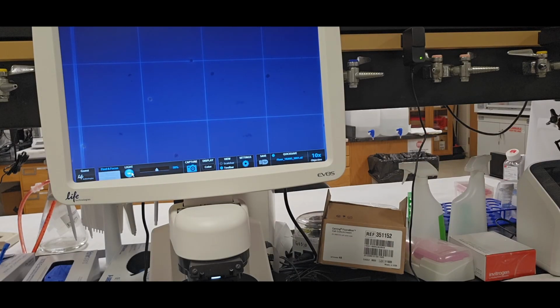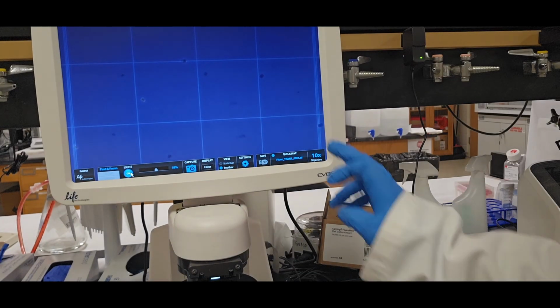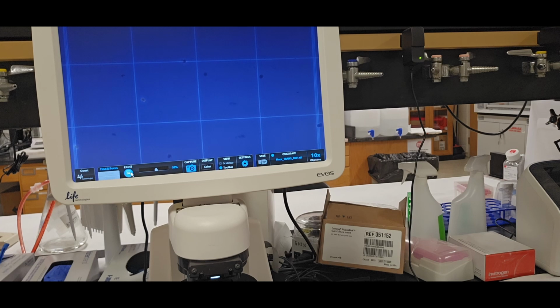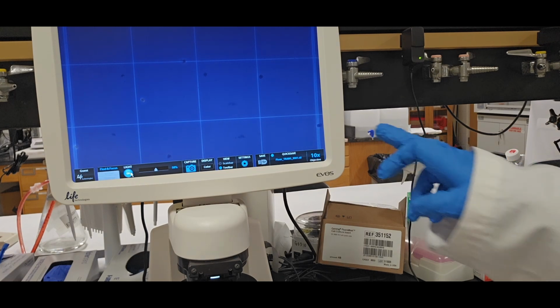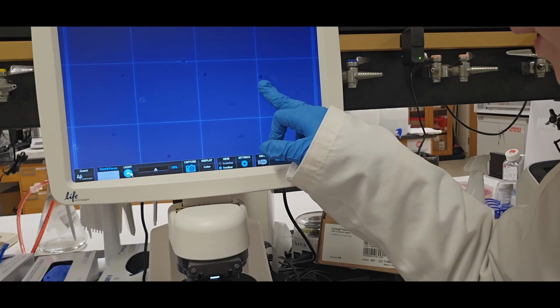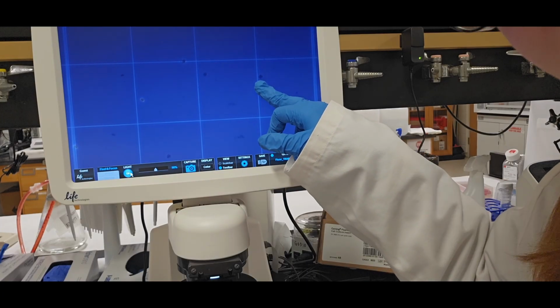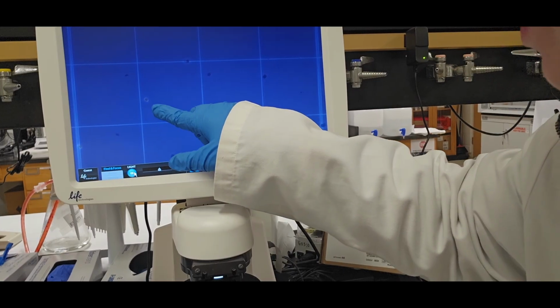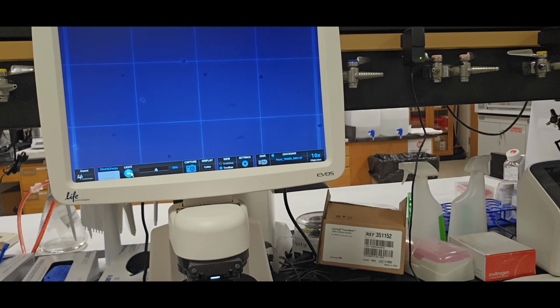So actually I've never done this before, but I'm doing a count on cells that I just thawed. So I don't actually think these are dead. Maybe they're just not reacting with the Trypan Blue as expected because they're freshly thawed. But some of these cells are. So if this was a typical cell count, I wouldn't count that one as alive, but it might be. Whereas that one that's glowing pretty brightly, that one is definitely live. That would be a count.